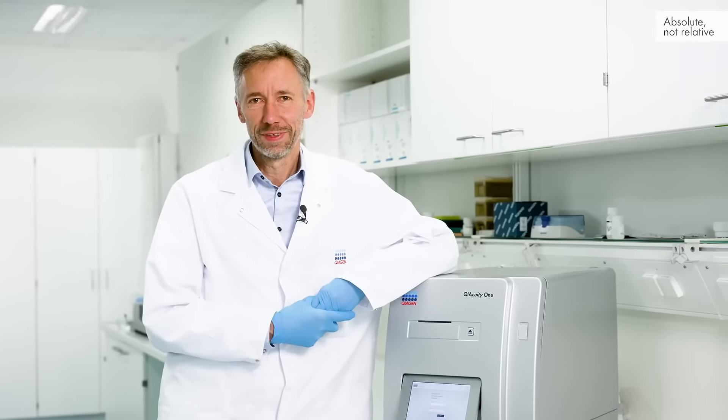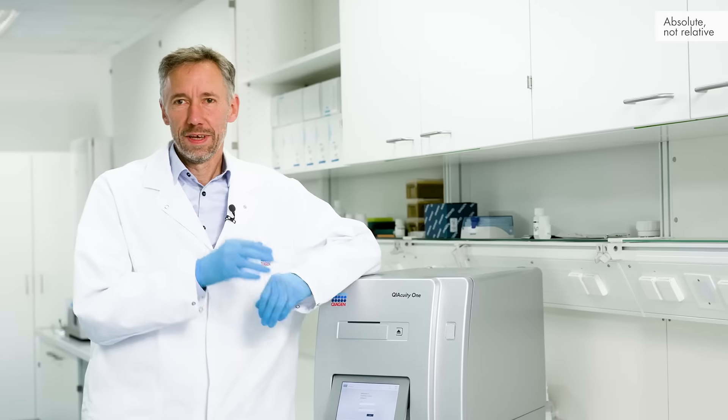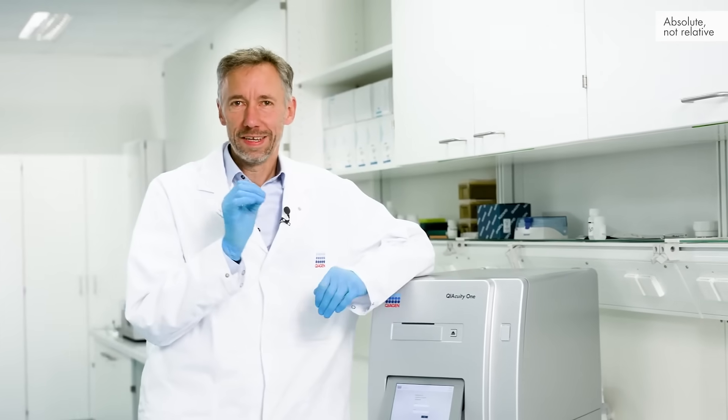What makes digital PCR digital? Digital PCR creates distinct on and off signals. It doesn't need the creation of a standard curve, so counting individual signals makes it an absolute quantification. And that's the difference.